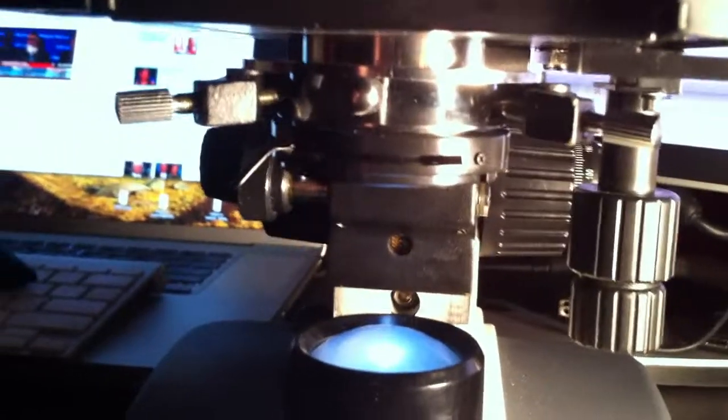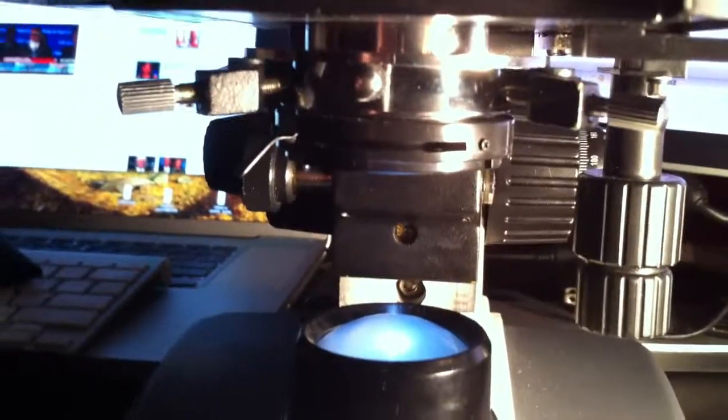Okay, so that's actually how the substage condenser works on the LabLearner microscopes. And let's take a look in the next clip at how we can actually remove it, or if it has been removed, to replace it.